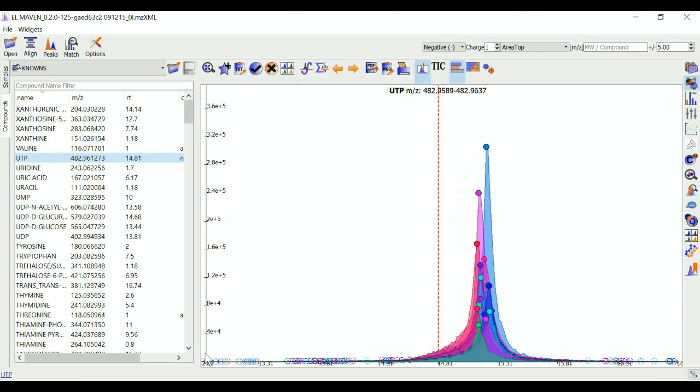This video is about the alignment feature in El-MAVEN. Prolonged use of the LC column can lead to a drift in retention time across samples. Alignment shifts the peak retention times in every sample to correct for this drift and brings the peaks closer to the median retention time of the group.